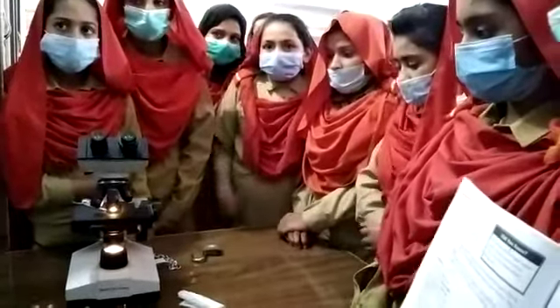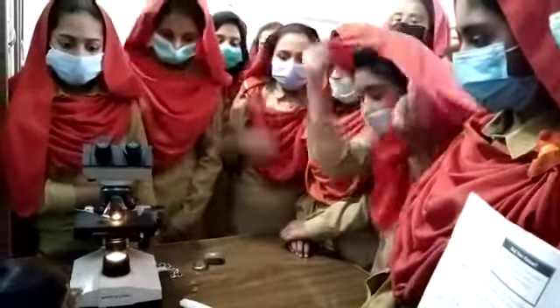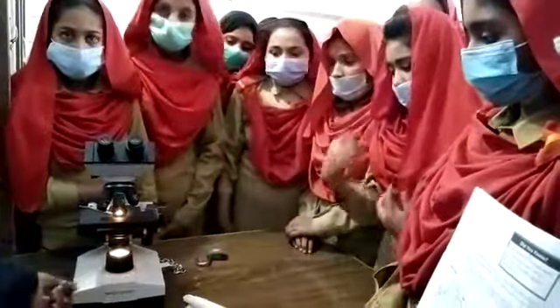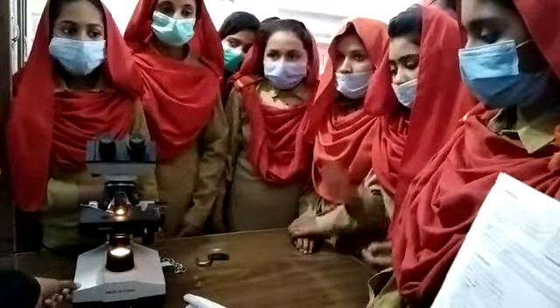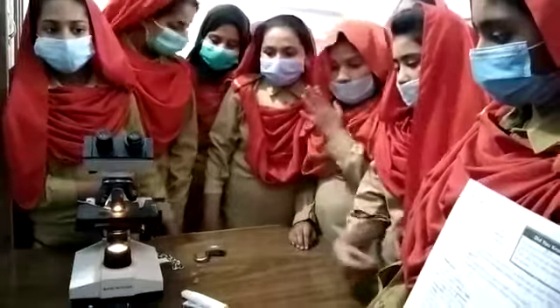In the class of the microscope, what is the microscope? The first one is the base. The base is here. You have a light. This is the light source.